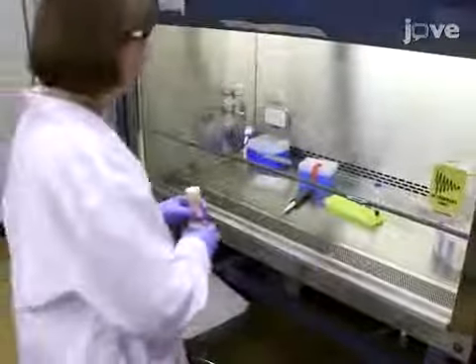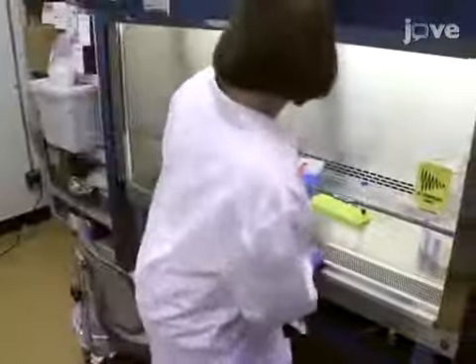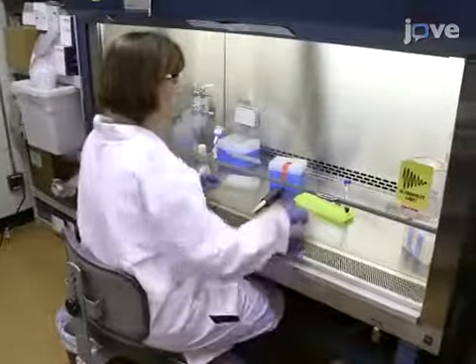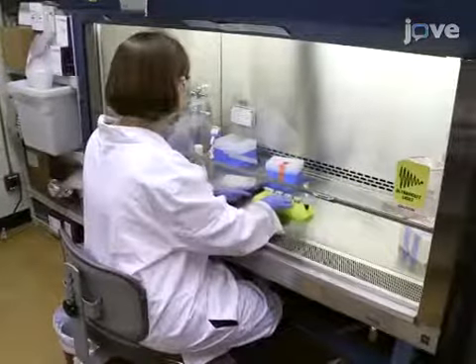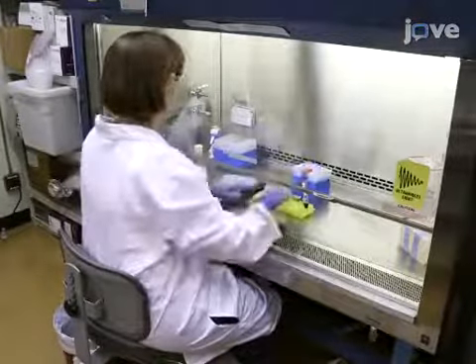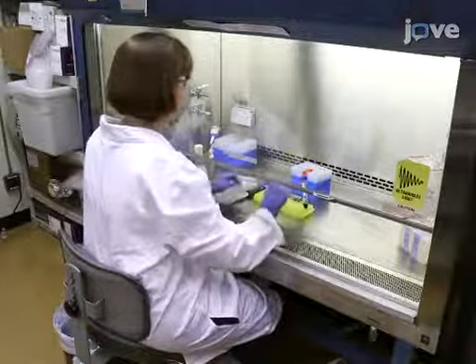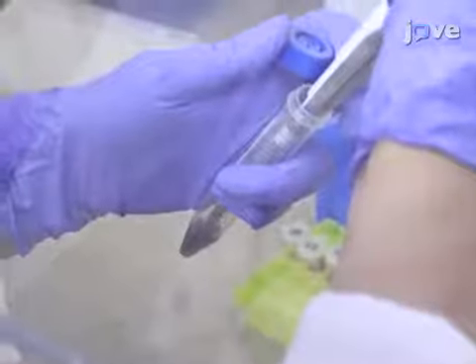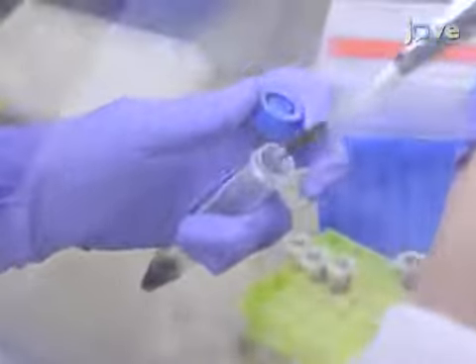Prior to starting this enrichment procedure, prepare a pre-culture of strain NRRL Y7124 in a 125 milliliter flask and a dilution series of the Ammonia Fiber Expansion pre-treated corn stover hydrolysates.